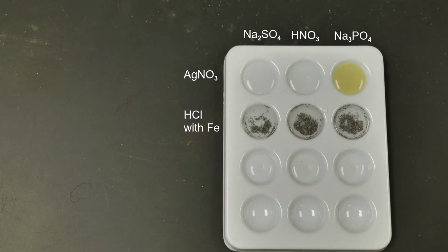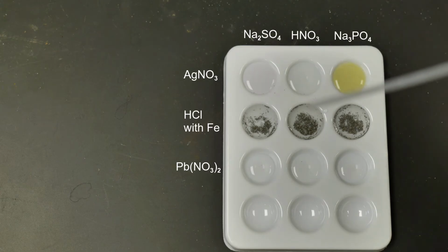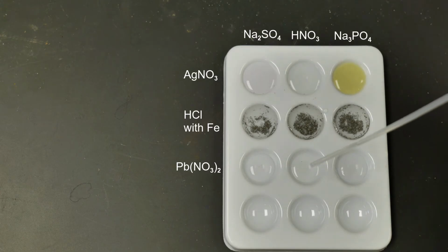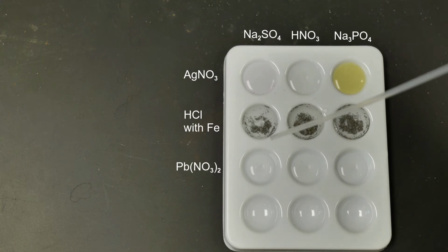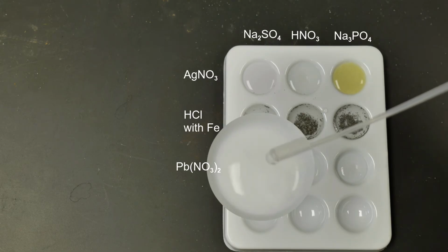All right, now for the third part, we are going to add in lead 2 nitrate into the sodium sulfate, the nitric acid, and the sodium phosphate. So here we go. Again, lead 2 nitrate being added to sodium sulfate. Do we notice any change here?